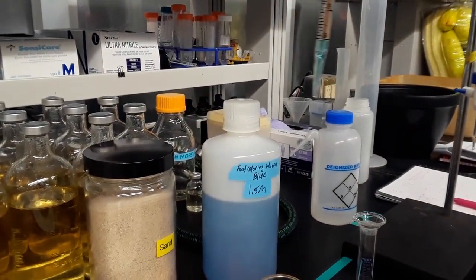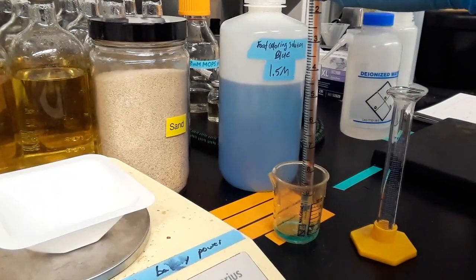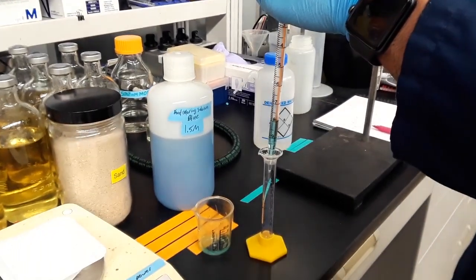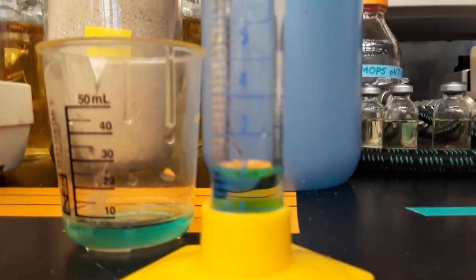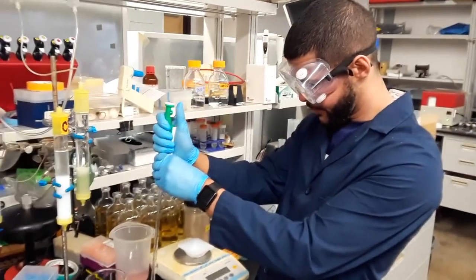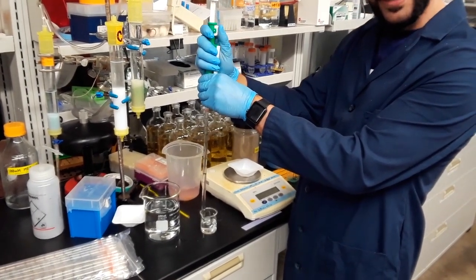So there you have 2 milliliters. That was 1, sorry guys. Now we have 2 milliliters. And I'm going to dispense this into the 10 milliliter graduated cylinder. And all you will do from there is take up from our beaker of water, we're just going to take up 8 milliliters of water because we need to fill it up to the 10.